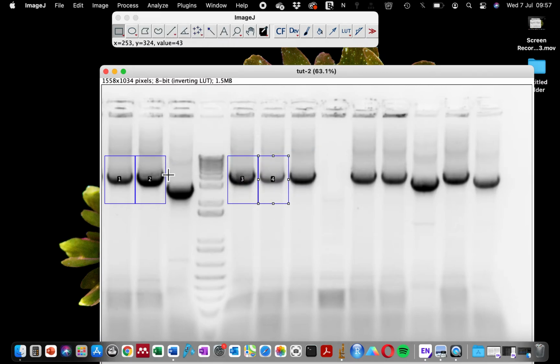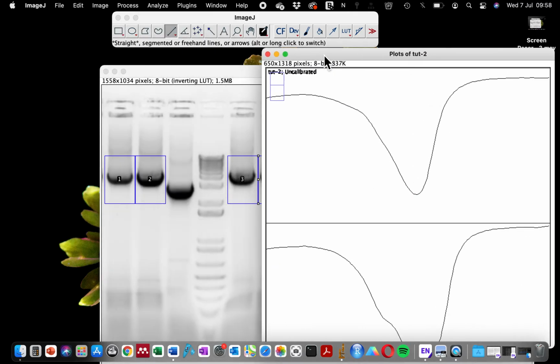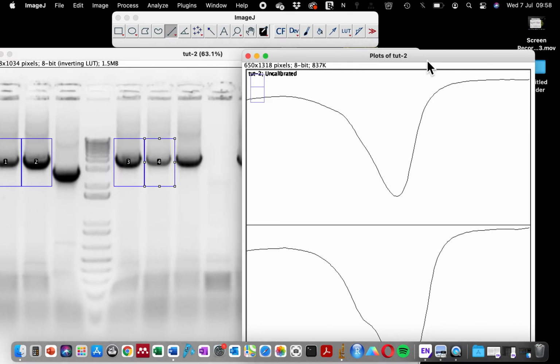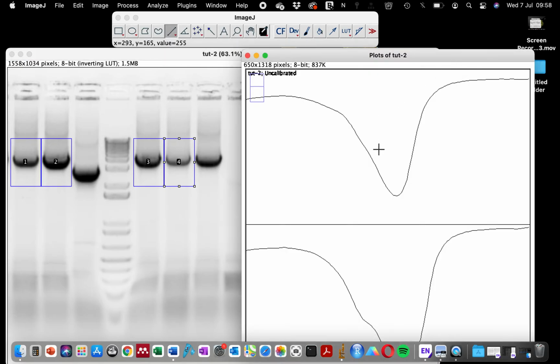So now we have these four different bands that we want to quantify. In order for us to quantify this, we just go back again to analyze gels and we click on plot lanes. What the plot lanes has done is to plot each of these bands, to plot the peak. Don't worry that the peak has been plotted in an inverted format. It's still going to do the same function.